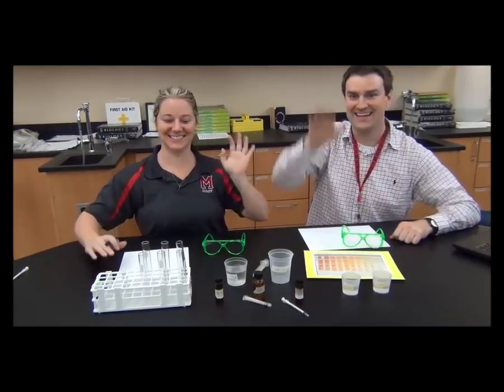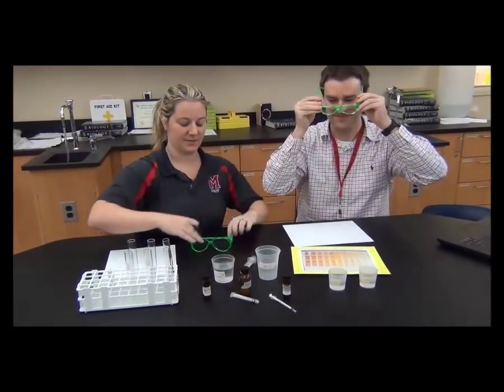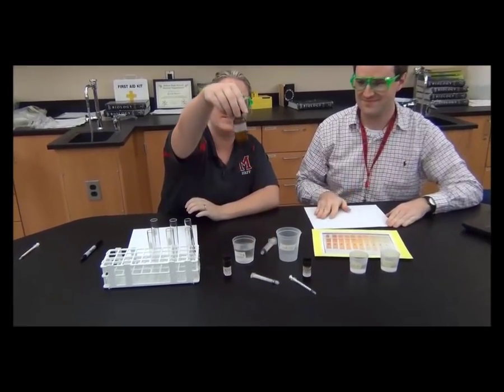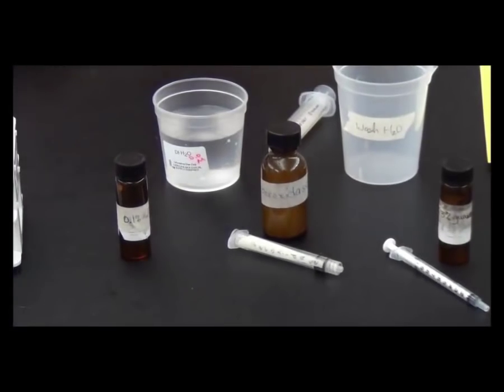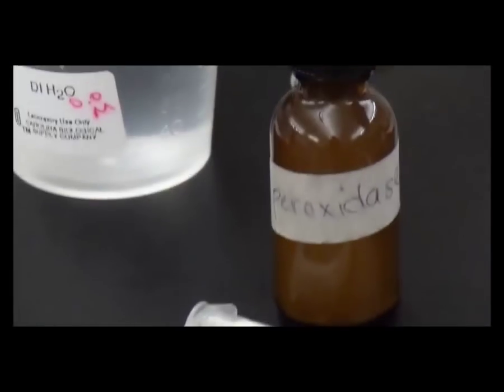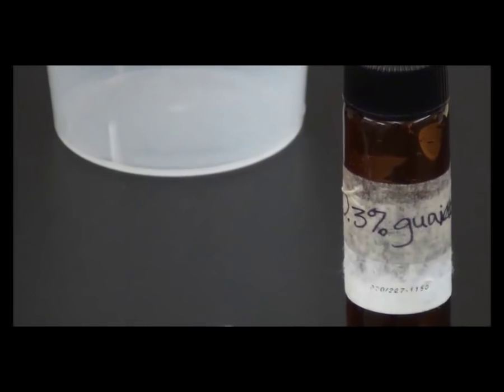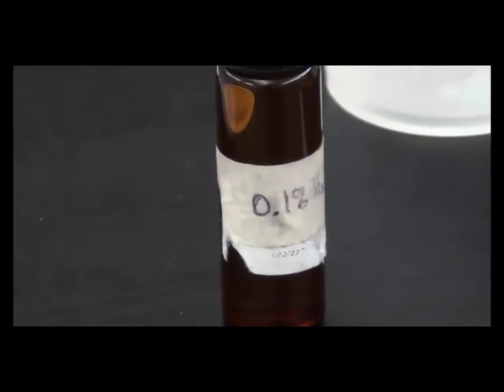We have a quick film here teaching you how to do the lab — also read your lab procedures. First things first: lab goggles, please, always on while working with the chemicals; you can take them off after cleanup. All of your chemicals are labeled. Here's the peroxidase enzyme. You'll see that we have syringes labeled for every liquid, so make sure you use the right syringe with the right chemical. You have your guaiacol — the chemical that turns colors — and then your hydrogen peroxide tube full of hydrogen peroxide substrate.